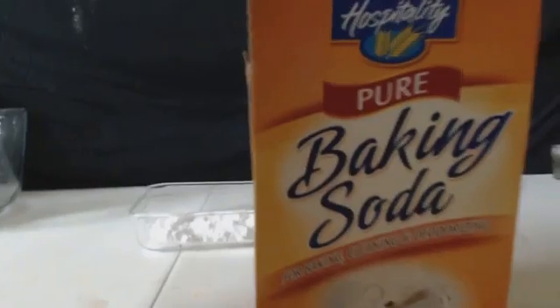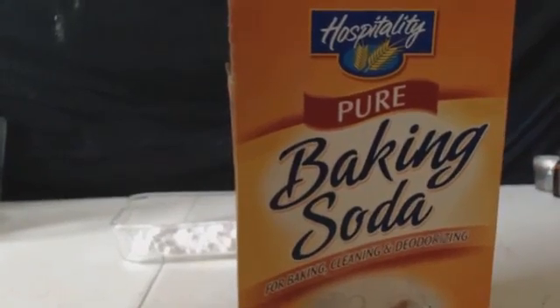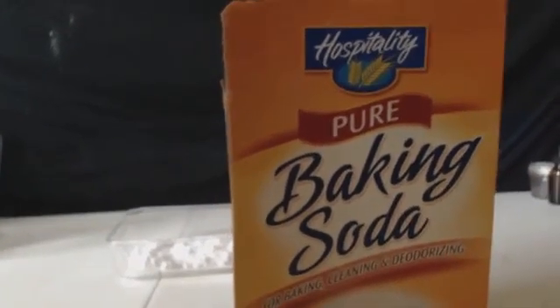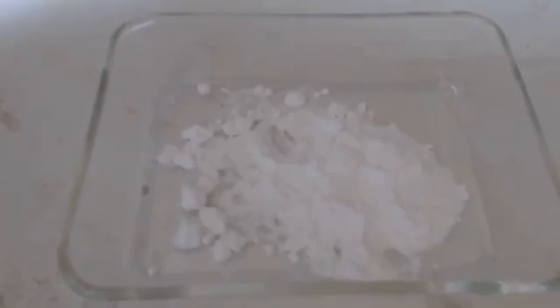Hello, this is John Black, Super Chemist. We're here to make some sodium carbonate. Right here I got 42 grams of sodium bicarbonate. Like I said in another video, it's just basically baking soda, 100% pure. I'm just going to put that in the oven at 400 degrees and we'll see what happens.